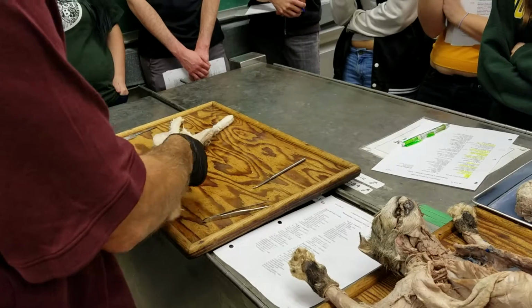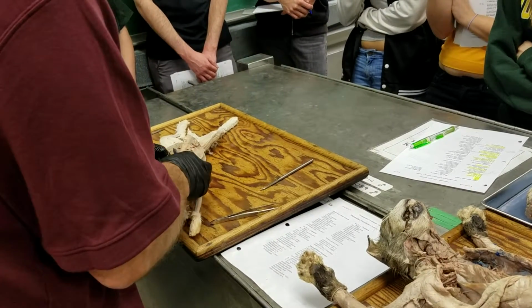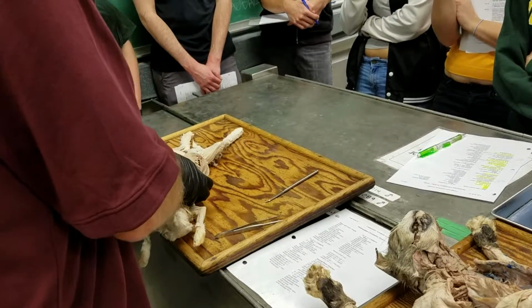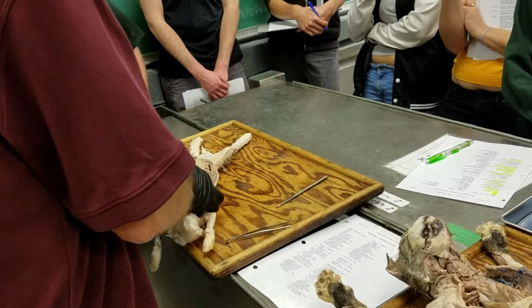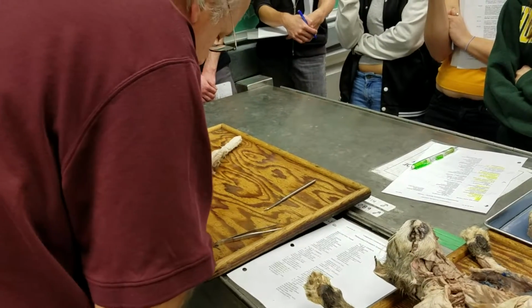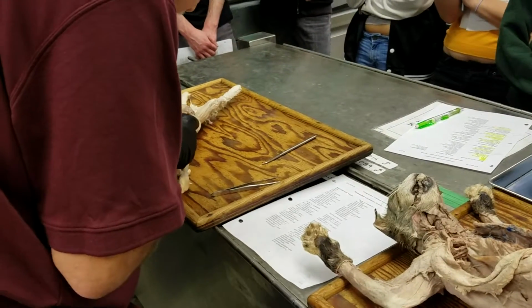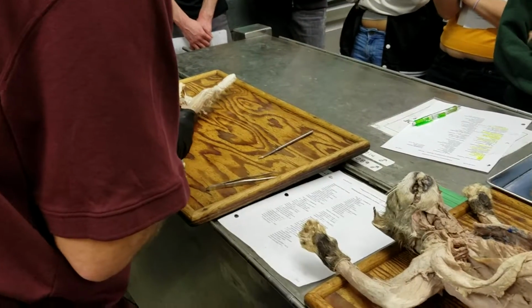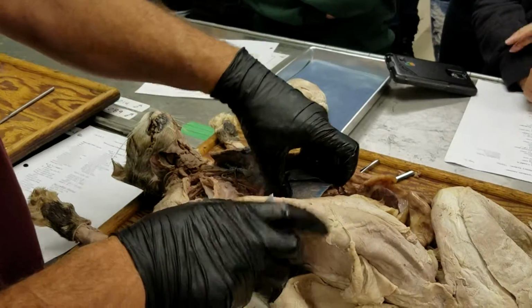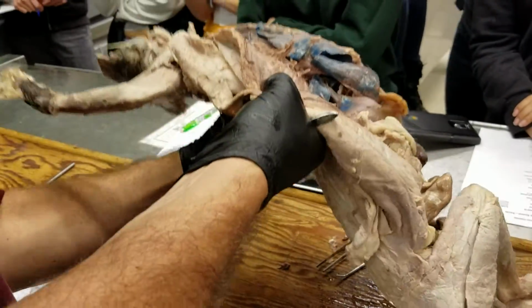Okay, there is a vessel that comes up and joins in with the right cranial vena cava, right behind. All right, and it's a little bit tricky to get to here. I'm not sure how well injected it was on this rabbit, because I haven't looked for it yet. Let's see if we can see. I think we're going to look for it on the cat, because it's easier to see on the cat. Yes, just harder to hold the cat, but that's okay.